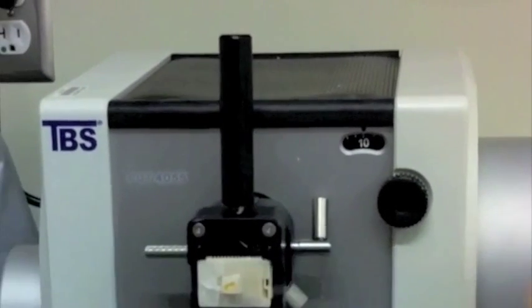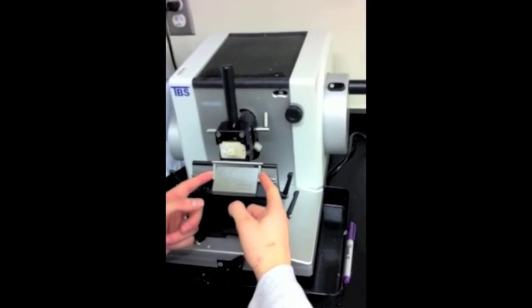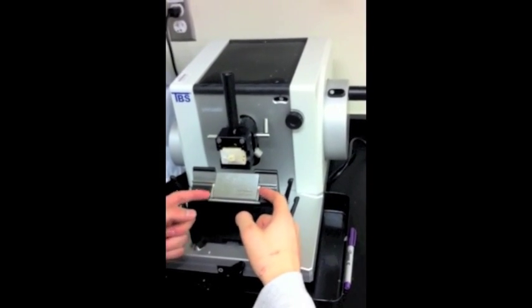Unlock the wheel on the right, release the finger guard, and turn the wheel swiftly until you have begun to cut into the sample.